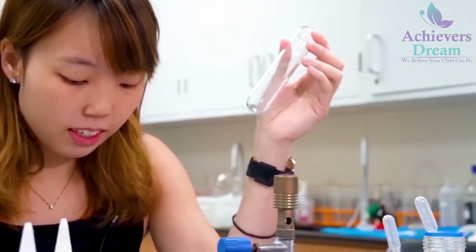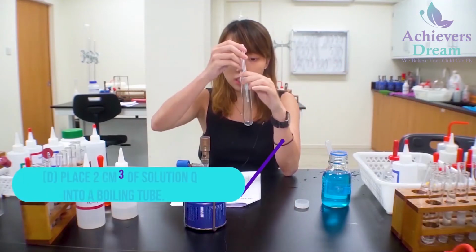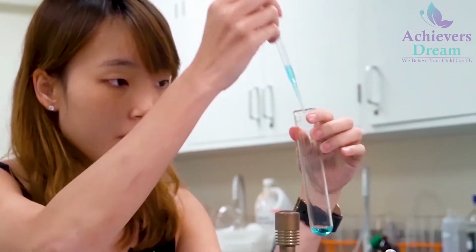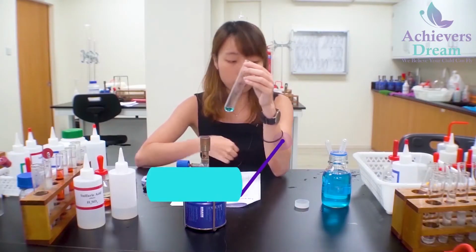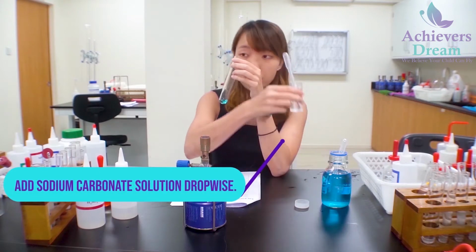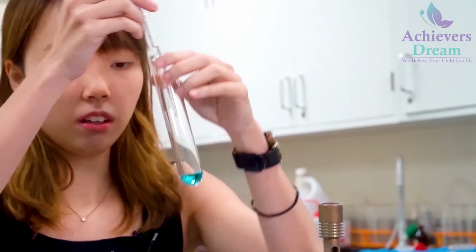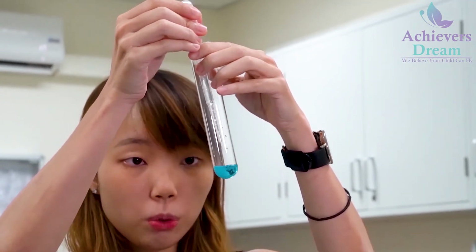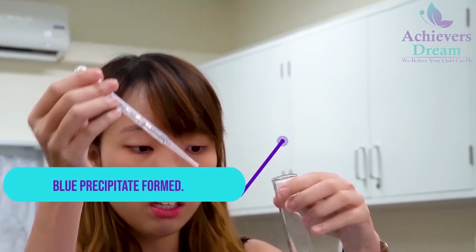Okay, so for part D, I'll be placing 2 cm cube of solution Q into a clean boiling tube. Okay, then after that, I'll be adding sodium carbonate solution dropwise. So this one is sodium carbonate. So upon addition of sodium carbonate, you notice that there's a blue precipitate form. Okay, so now I'll be adding in excess.